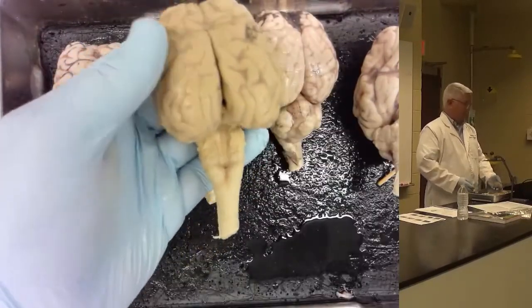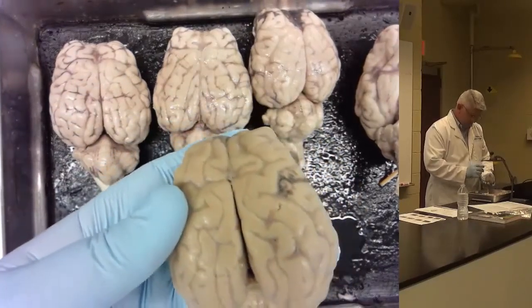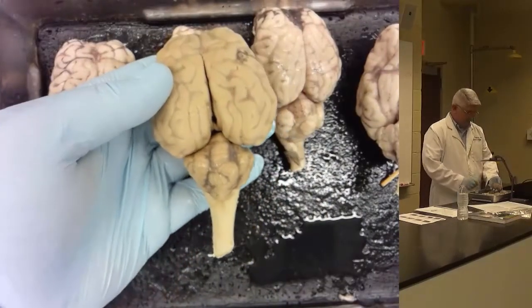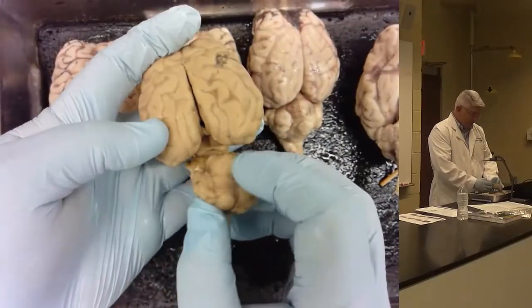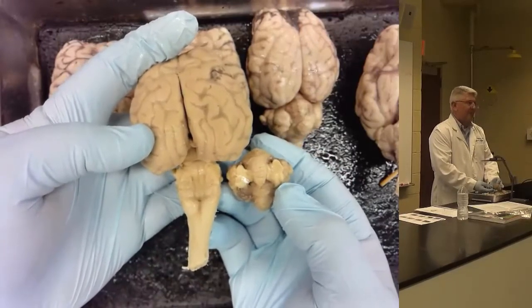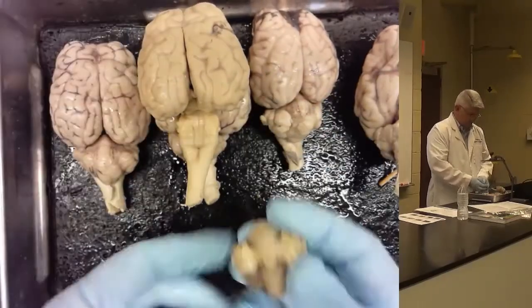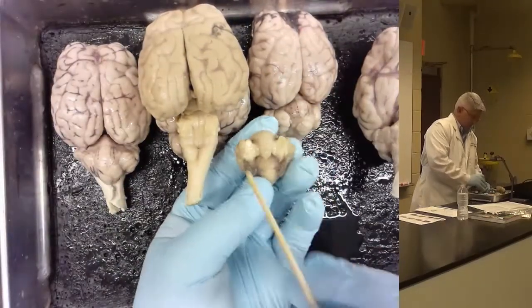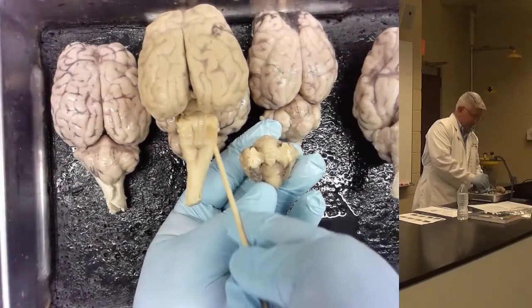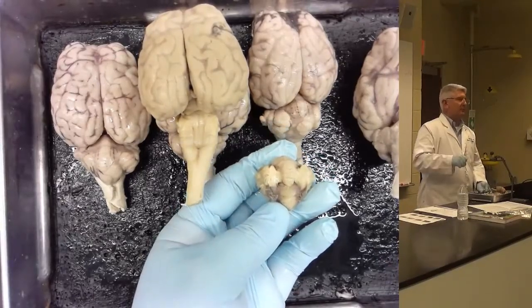Now, here we have a brain. What's wrong with this brain? Yeah, it lost the cerebellum. So if I were to put its cerebellum back on, and take it off, you can see that white shiny substance that's been cut in order to take the cerebellum off, which on the cerebellum is this area here and this area here, and on the brainstem is this area here and this area here. That is called the middle peduncles.